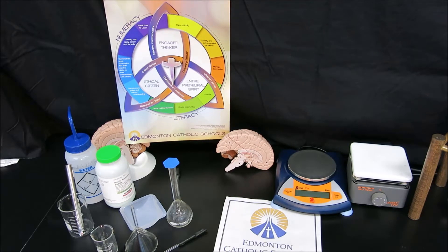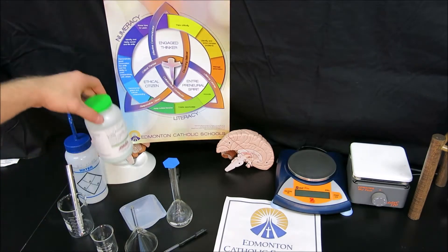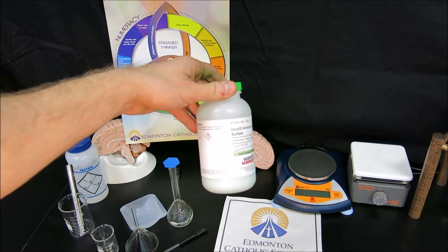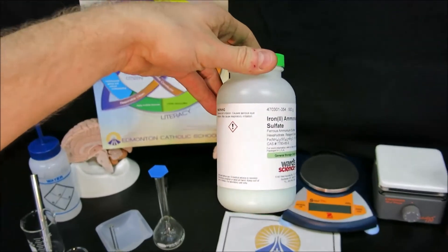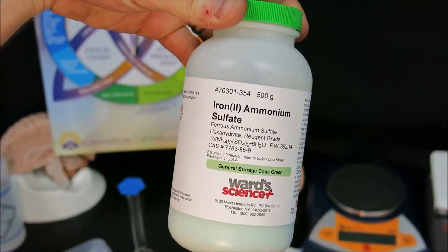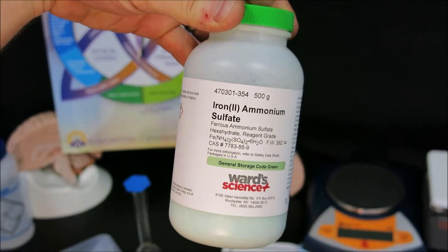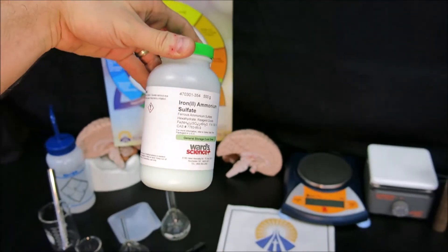Today, we'll be creating a standard solution of iron(II) ammonium sulfate, which is a common primary standard for redox titrations.